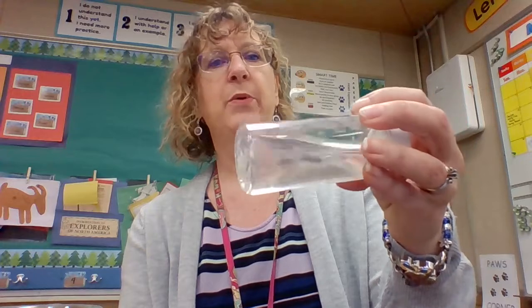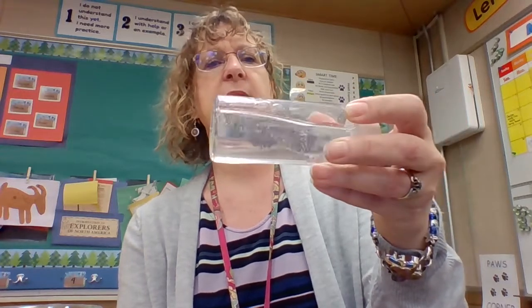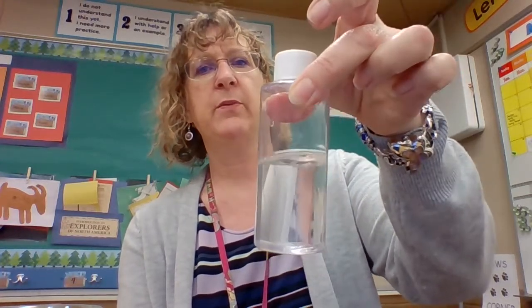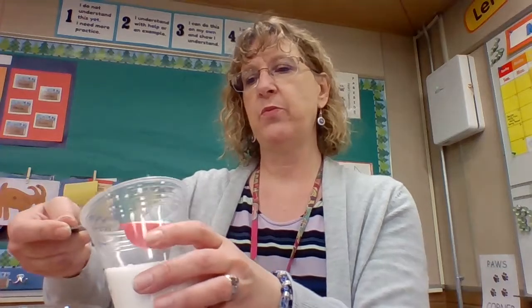All right, so here we go. I've shaken it up, and it's pretty well dissolved. I can see some air bubbles, and I'm starting to notice the water clings to the side of the bottle when I shake it a little bit. We're going to add 1 more scoop, see what happens after this next scoop. Another big scoop. Make sure it's pretty level. There we go, in it goes, and we'll see what happens next.